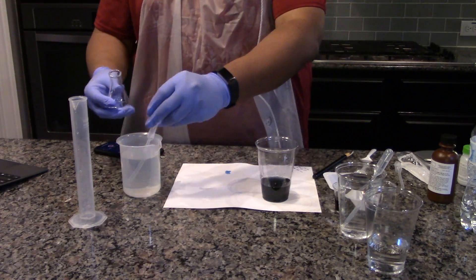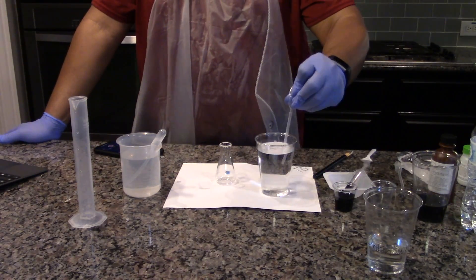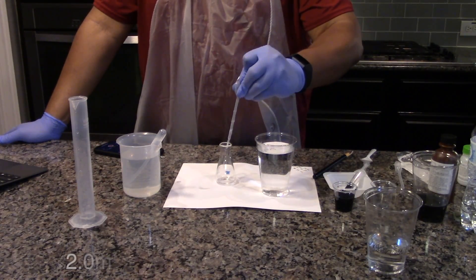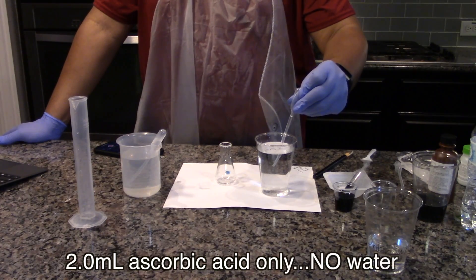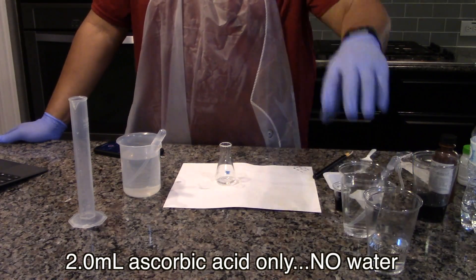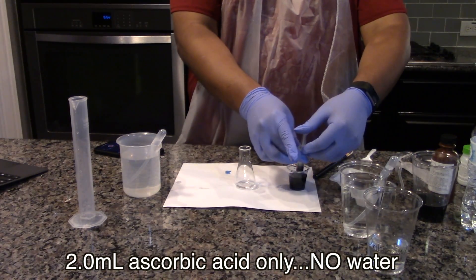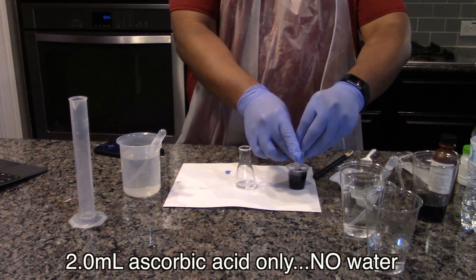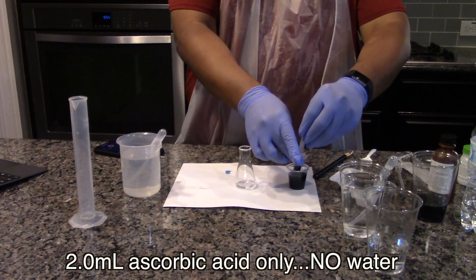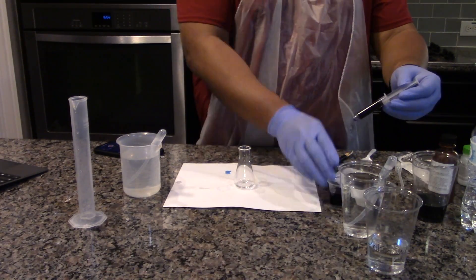Perform the titration for the 2.0 grams per liter ascorbic acid sample. Transfer 2 mL of ascorbic acid to the flask. Do not add any additional water. Follow the same procedures as the previous titrations.